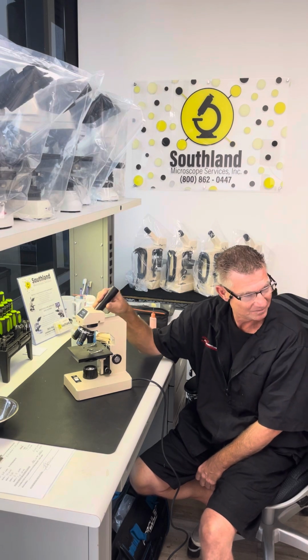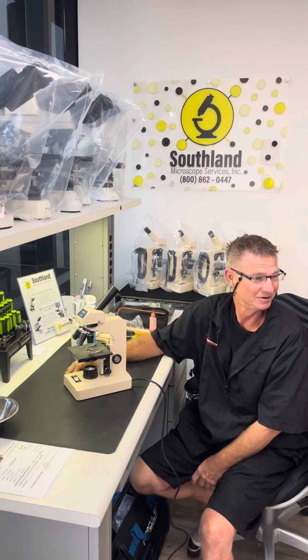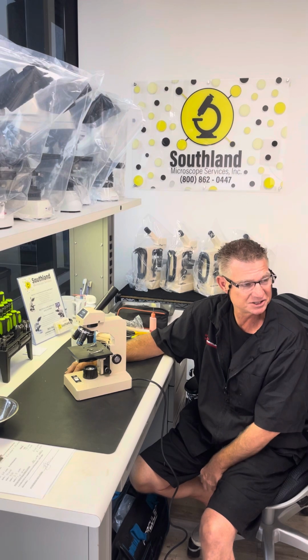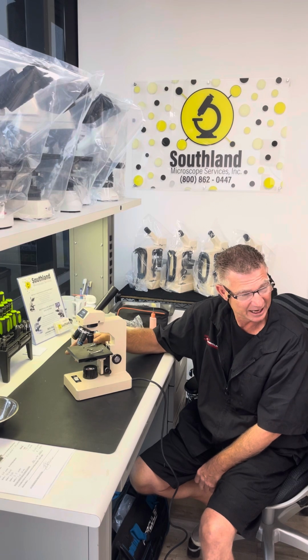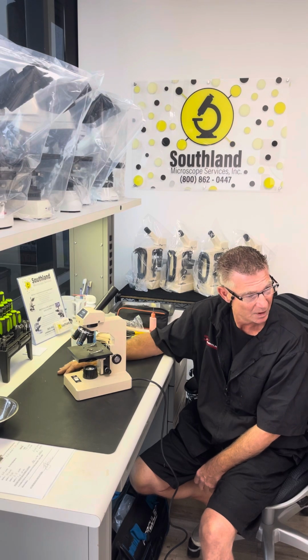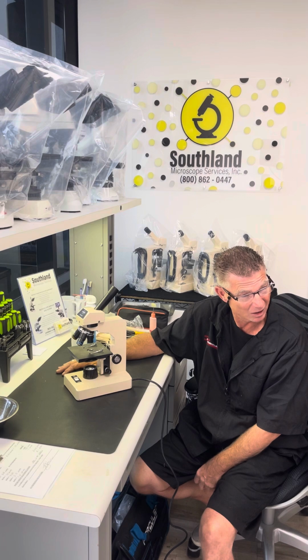It's a tool for learning, for developing, for solving. Many different industries use this for things. We're talking about cells in the biological department, meaning they're teaching it in education, botany, and healthcare. So they use this to look at blood in hospitals. They use it a lot in biology.